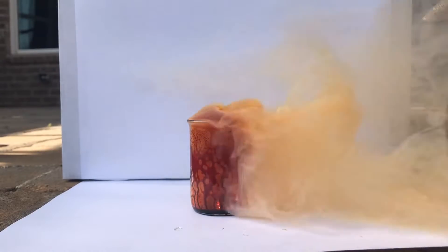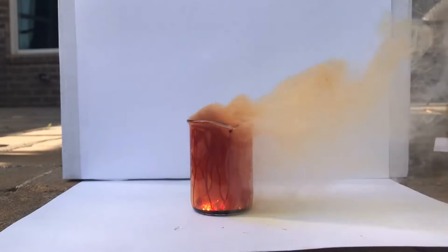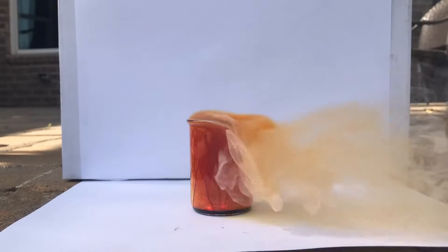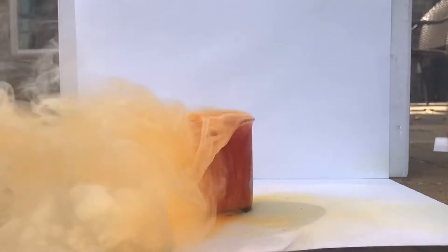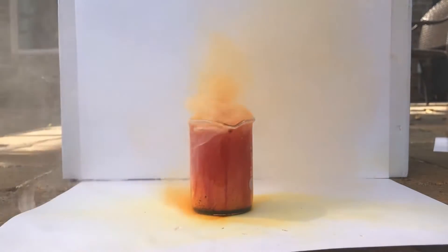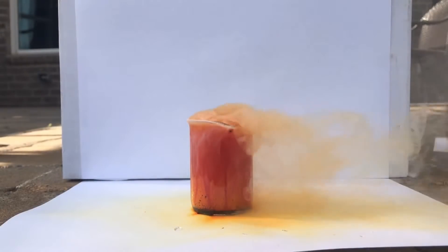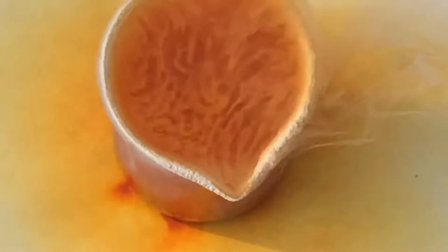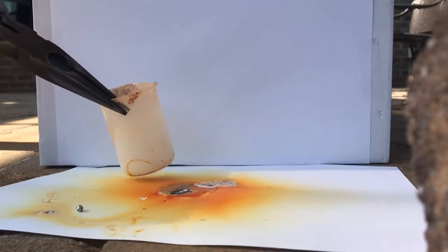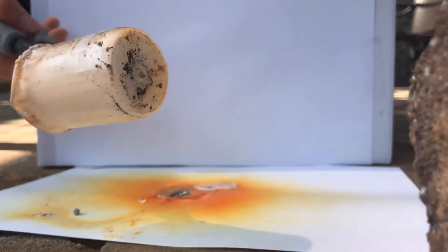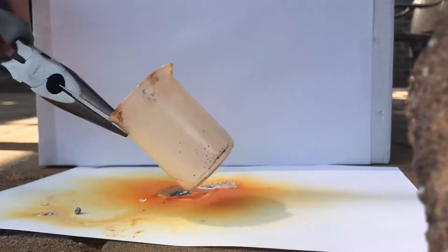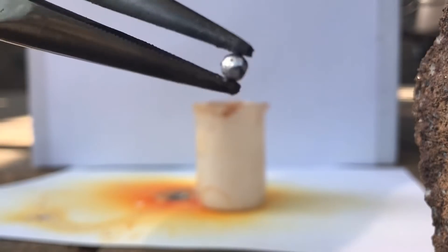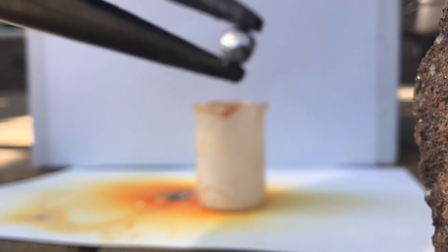Uh oh. What the fuck is that? Oh, that's sick. Oh no, you can't see it in the fire. Oh my gosh. Oh no. But my glass beaker is fine. Alright so sadly if you heard in the video it actually cracked the beaker, so yeah that sucks but we got a little aluminum ball right here. Bromine reaction got so hot it actually melted the aluminum foil into a little ball, pretty cool.